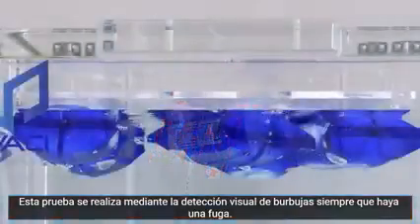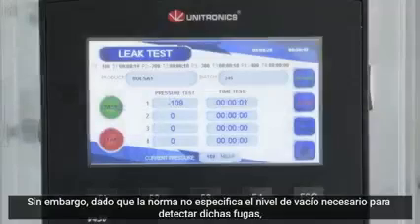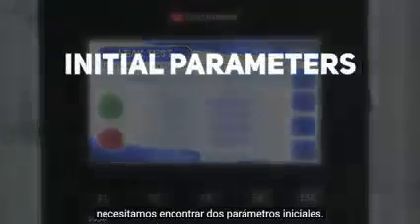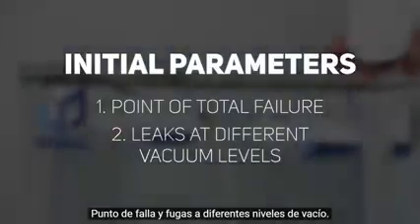This test is performed by visual detection of bubbles whenever a leak is present. However, since the norm does not specify the level of vacuum necessary to detect those leaks, we need to find two initial parameters: point of failure and leaks at different vacuum levels.